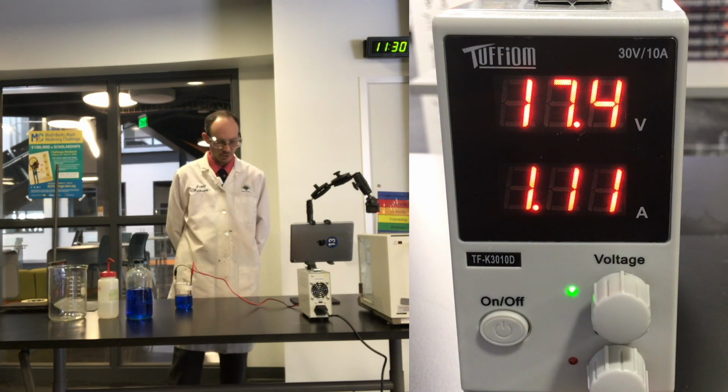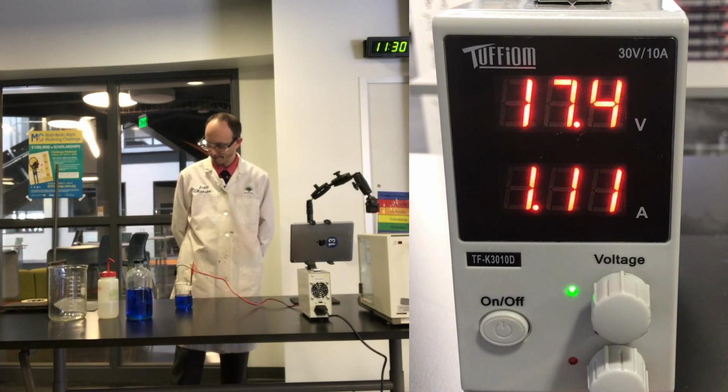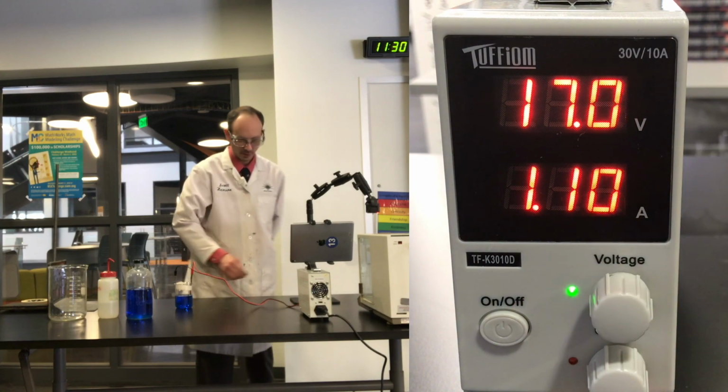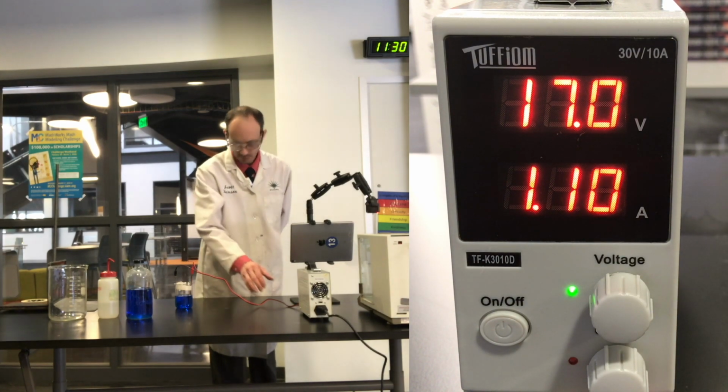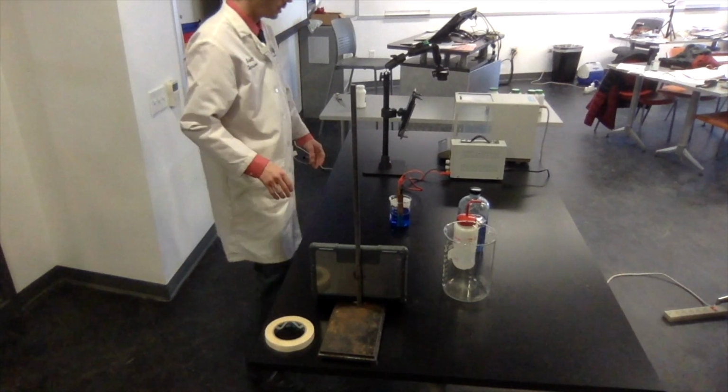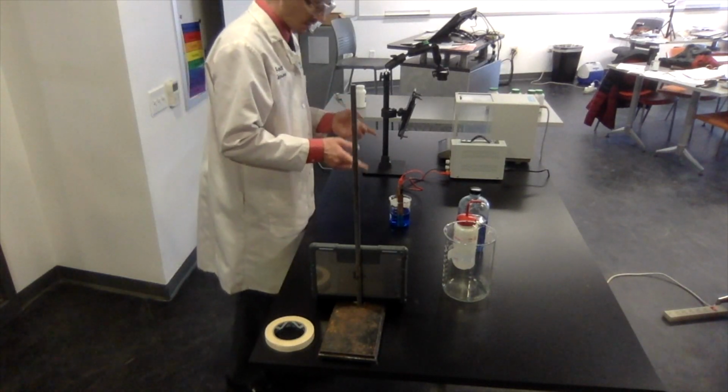Okay, about 10 more seconds, then we're going to turn it off. All right. So now we've turned off our system.